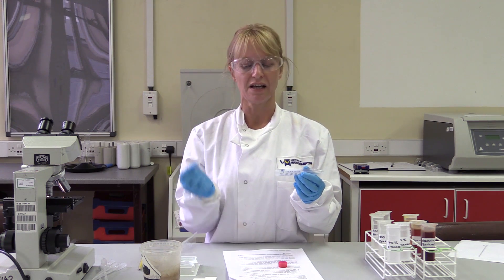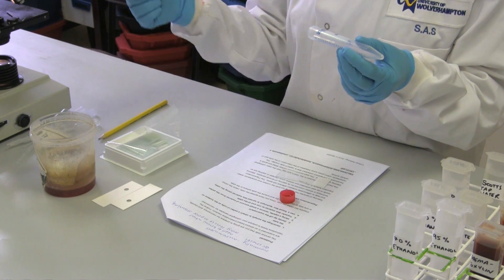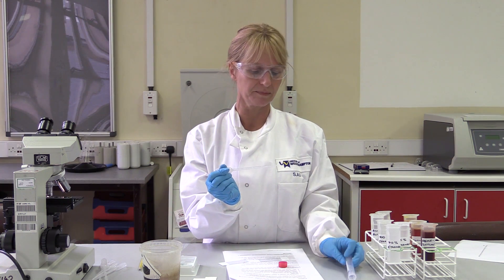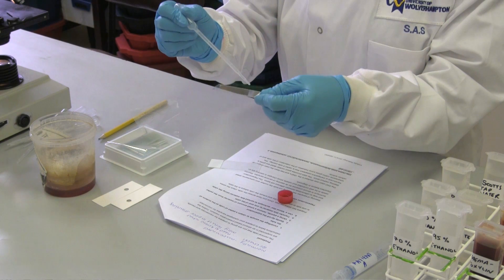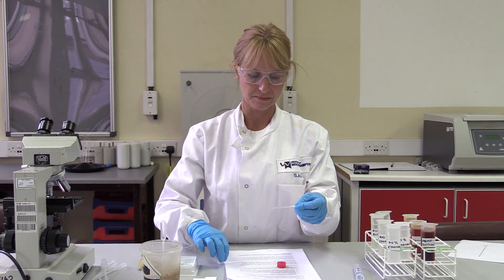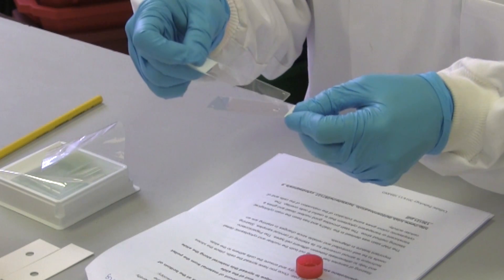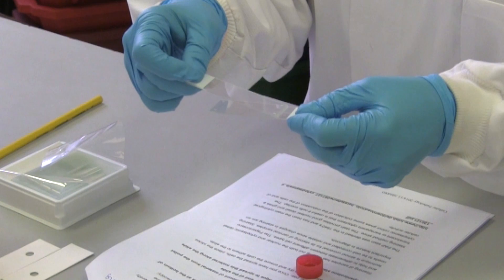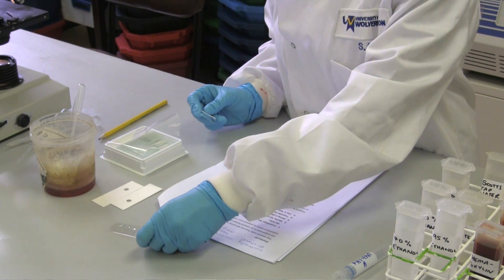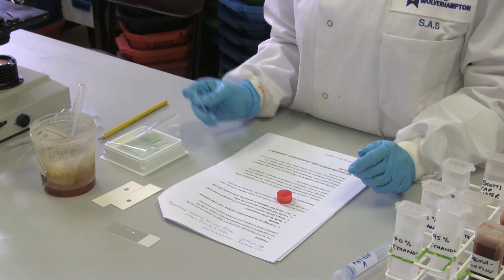You then need to get your pipette and two glass slides. Take a sample of the pellet from the bottom and place a spot of it onto the slide. Get your other slide, place it right next to the drop and touch the drop so the cells spread all along, giving you a nice even layer of cells along the slide. Then put your slide to one side ready for it to dry so the cells attach to the slide.